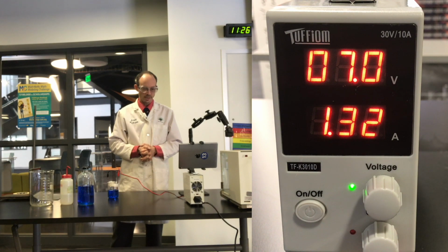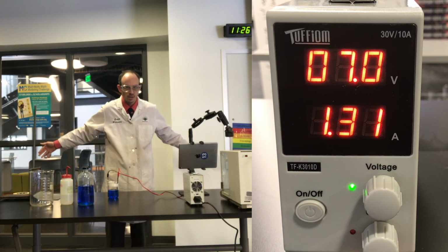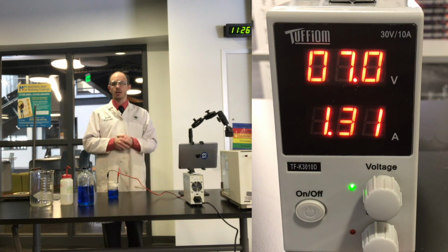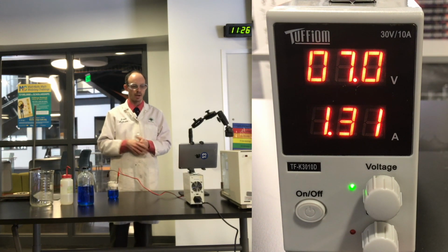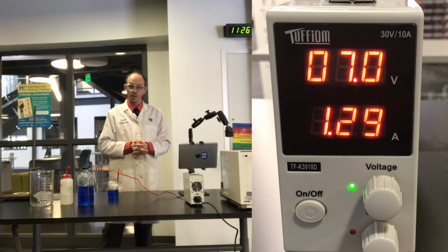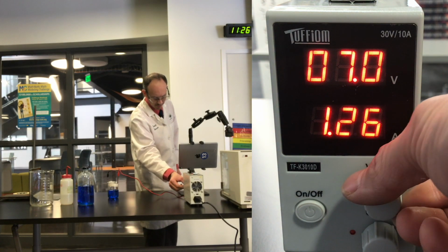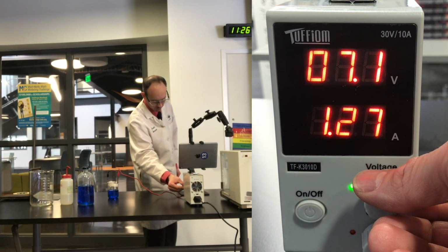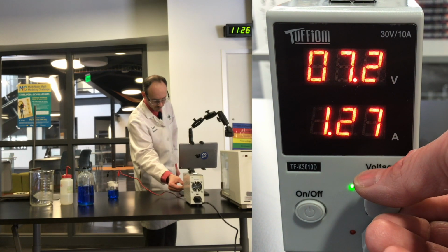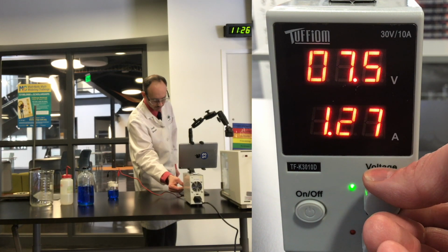We are only running 7 volts through this system. We don't want to do much more than that, because then it generates too much heat, and the more heat that's in the system, it just starts amplifying higher and higher in terms of amps. So right now we're staying pretty consistent at 1.30 amps. I'm going to try to keep that as consistent as possible by maybe messing around a little bit with the voltage, just to try to keep it at 1.3 for this whole process.